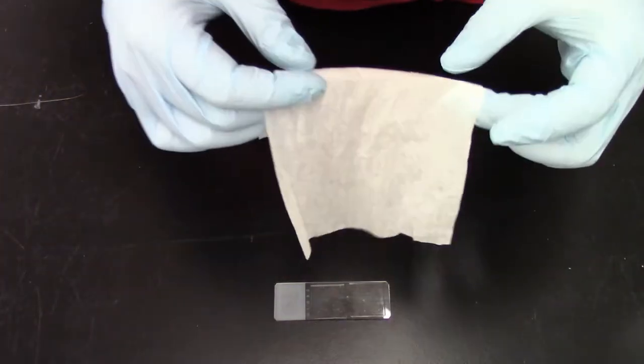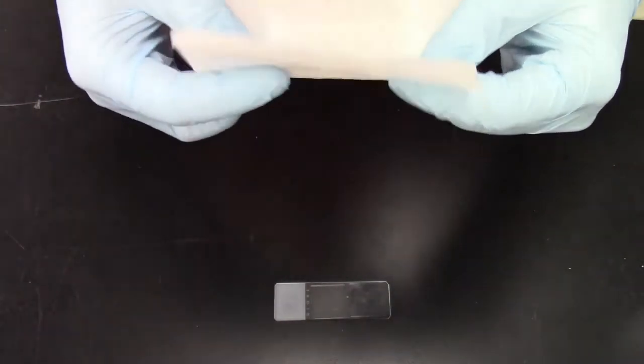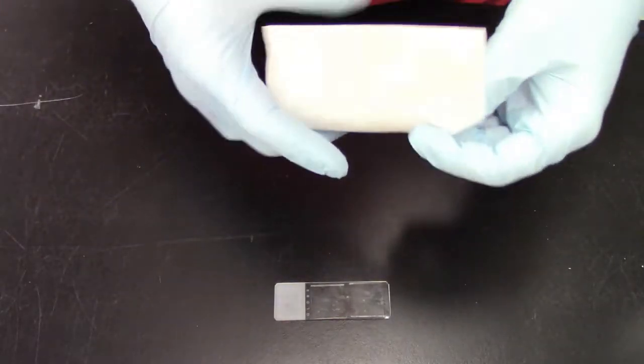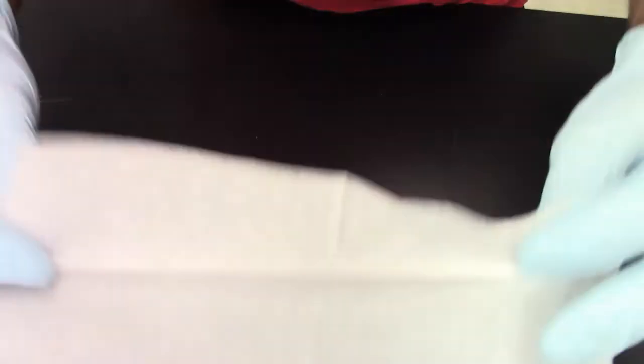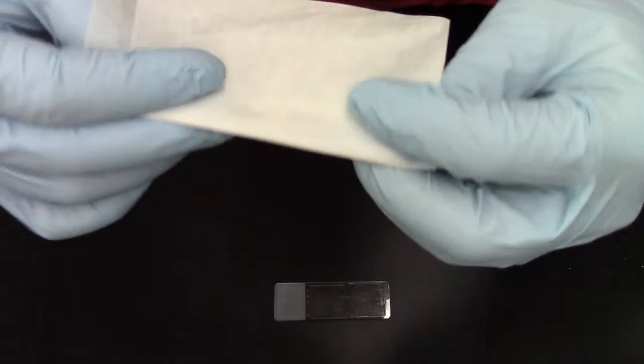There are many different ways you can do it. Of course you can buy some reagents and do it that way. You can use different specific tools to do it. But here is my favorite way to do it. You take a kimwipe, just a regular kimwipe, and you start folding it into something that resembles a wedge.